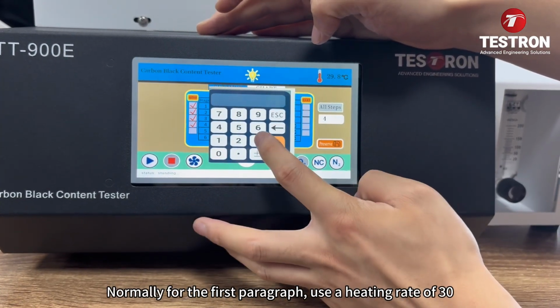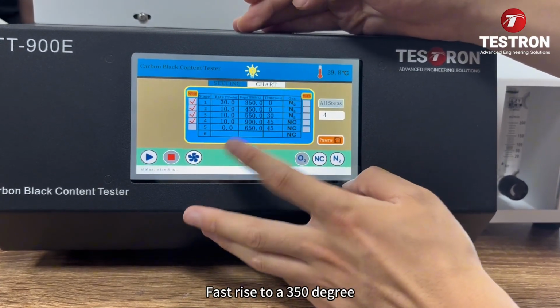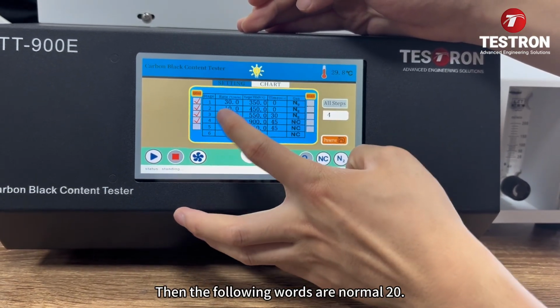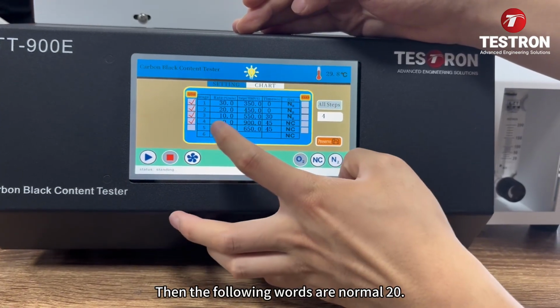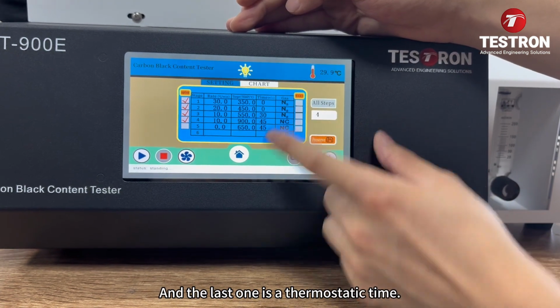Normally for the first paragraph, use a heating rate of 30. It rises about 30 degrees a minute. Fast rise to 350 degrees. Then the following ones are normally 20. 2 tens are normal in the back, and the last one is the thermostatic time.